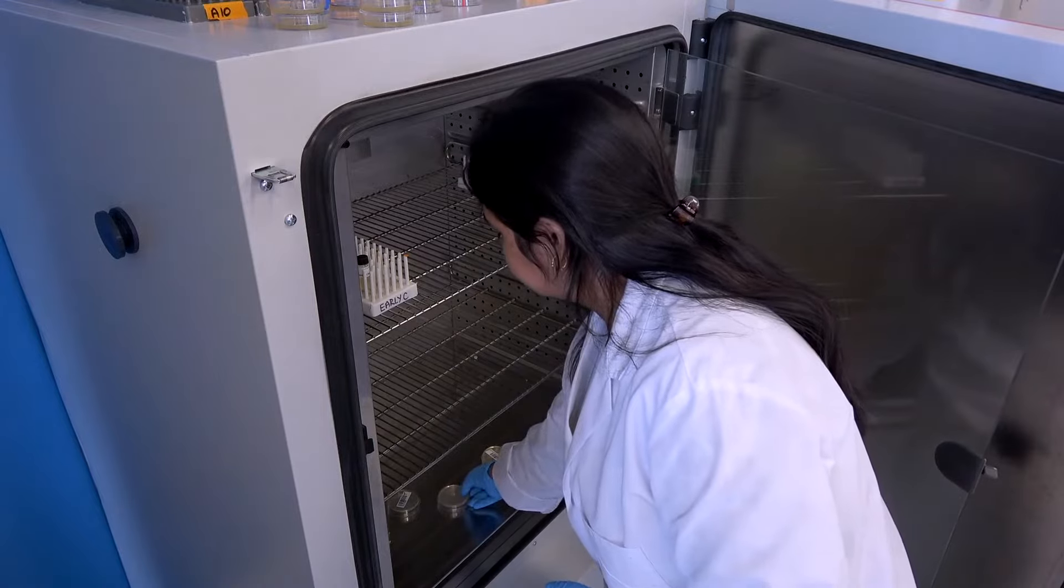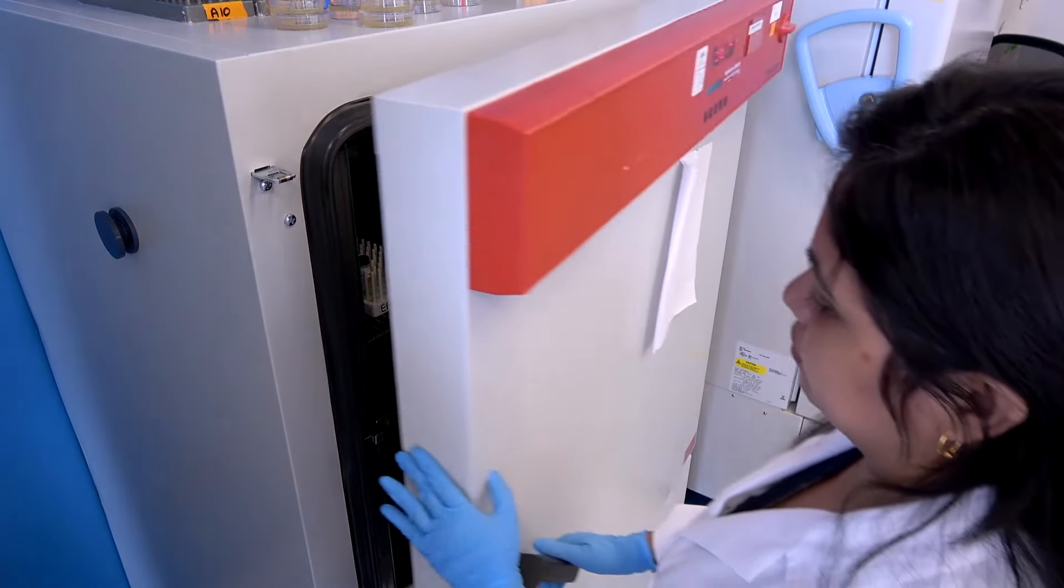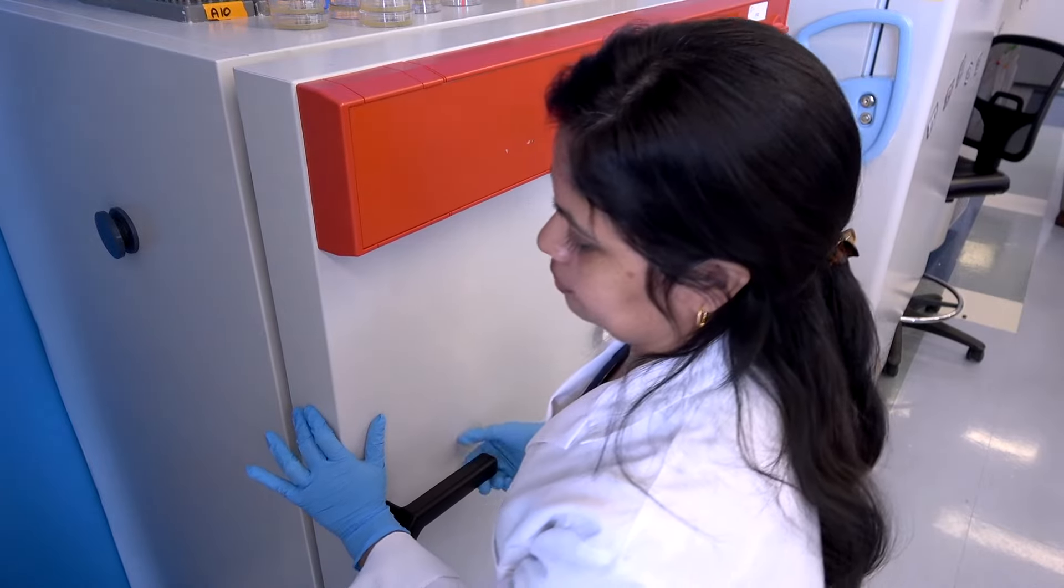While most strains require incubation at 37 degrees Celsius, some may require lower incubation temperatures such as 30 degrees Celsius.